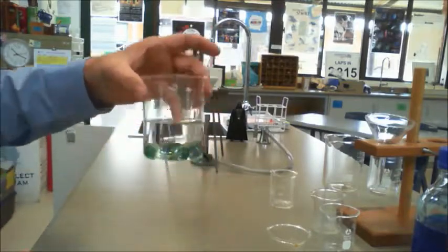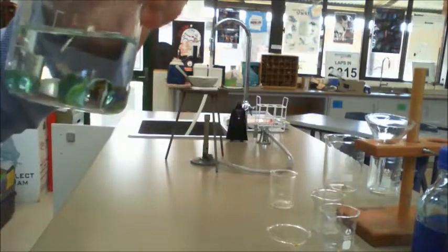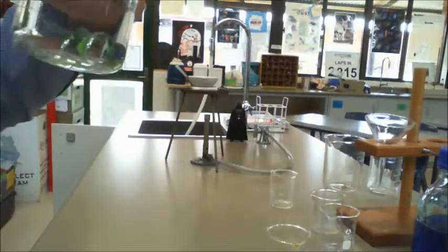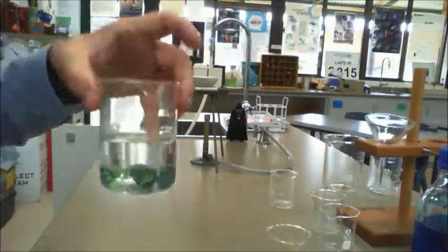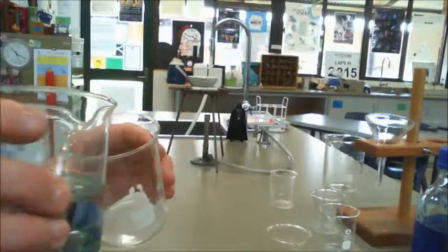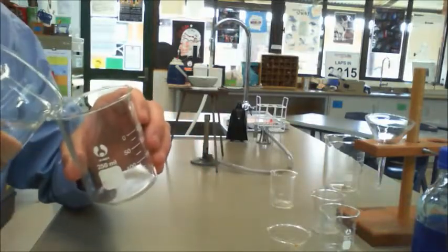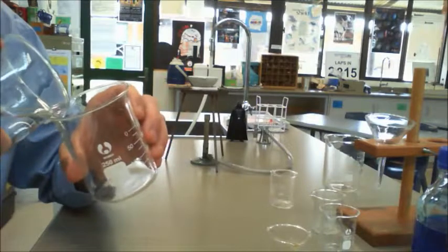Now, what I've got here to be able to show is some marbles in water, and that's just because, again, as long as it is insoluble, it really doesn't matter, and marbles are insoluble. Now, a way that you can basically do it is you can pour it out. I can do it by just pouring one of these into another.